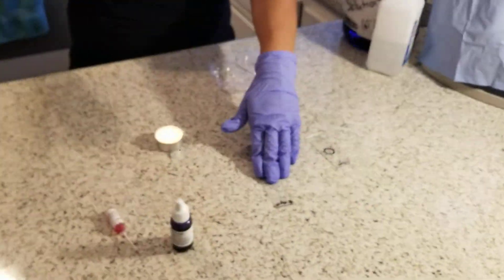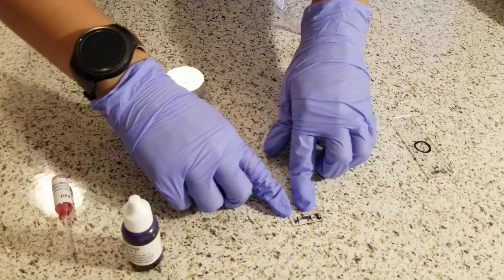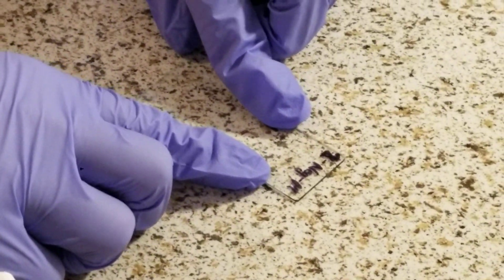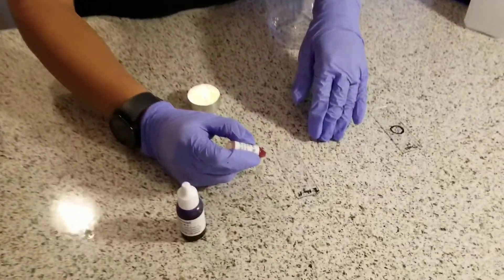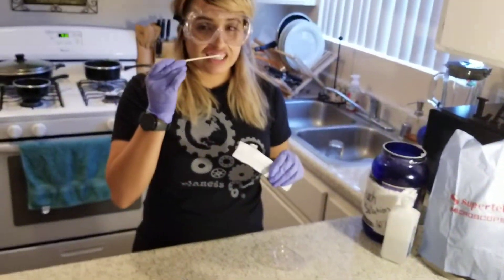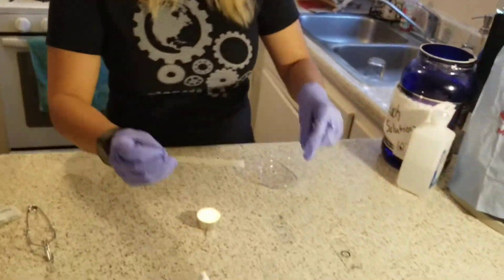On my second slide, '2' indicates it's the second slide, 'Negative' indicates this will involve a negative stain, and 'M' indicates that the sample will be taken from the mouth. I will use my Congo Red stain and place a single drop at the top. Then I will take my second sterile swab and smear it vigorously on the teeth and gums, then put it on the stain.